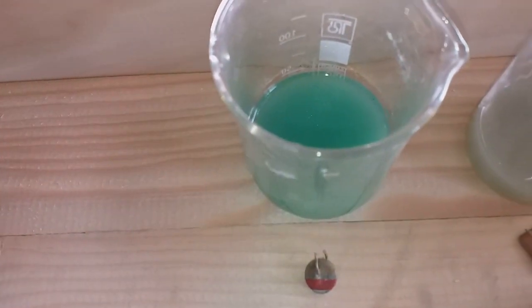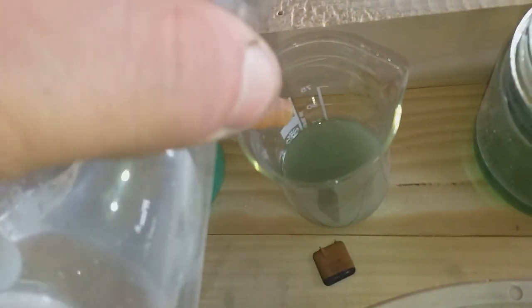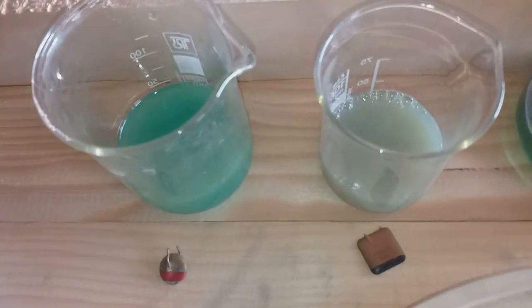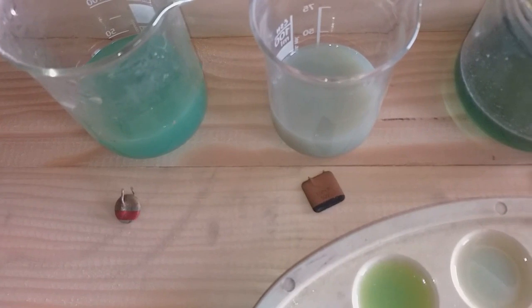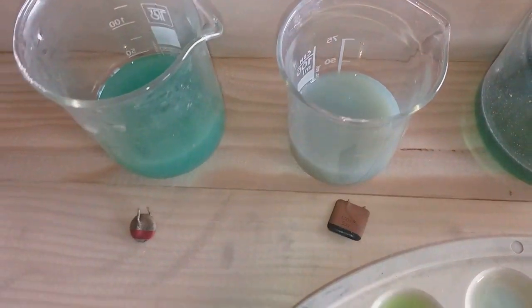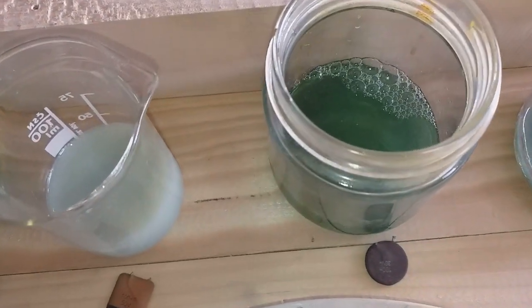If you see that — in the first one, no reaction. So this one, the rainbow color one, doesn't contain any silver. The square one — you may not see like I do, but I got a very slight reaction on silver. So this square one contains just a small amount of silver. The black one — no reaction.